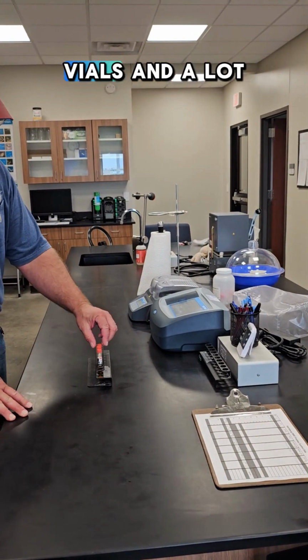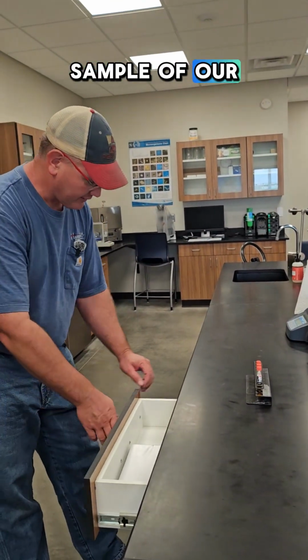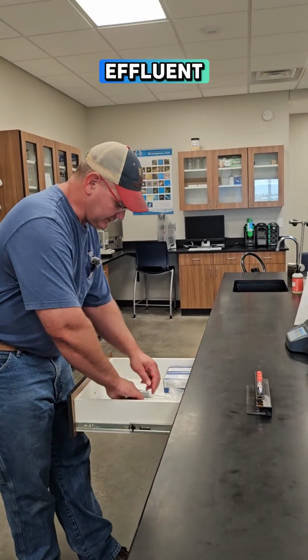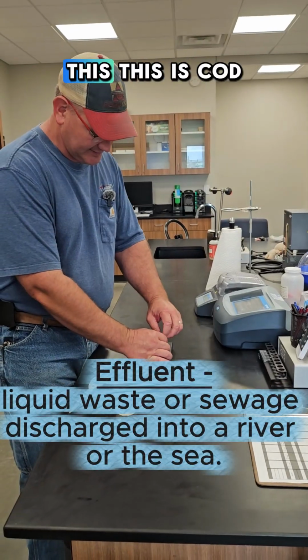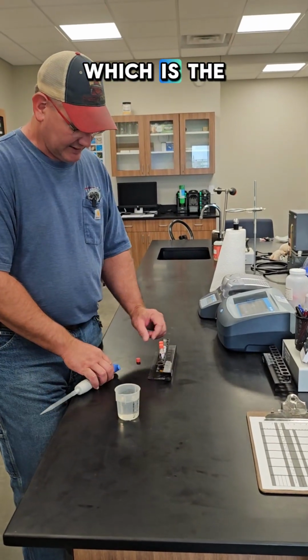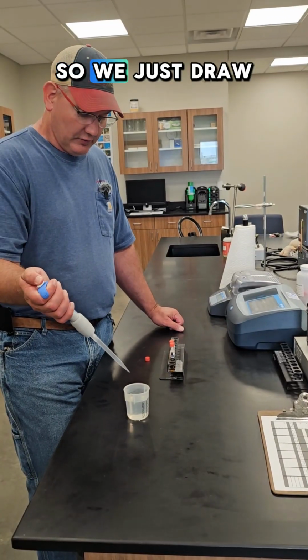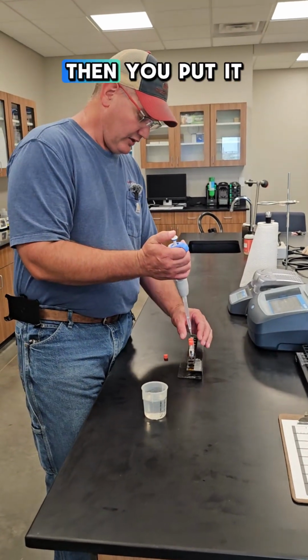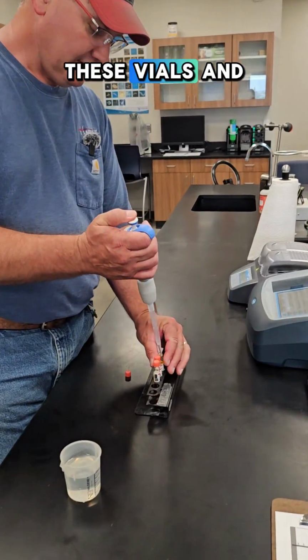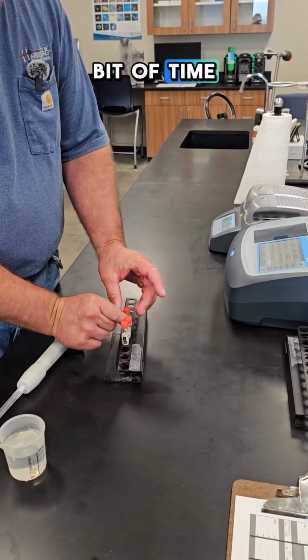We use these vials, and all it takes is we get a sample of our effluent. A test like this is COD, which is the chemical oxygen demand of the water. We just draw up some water like this, and then you put it into one of these vials, and these take a little bit of time to react.